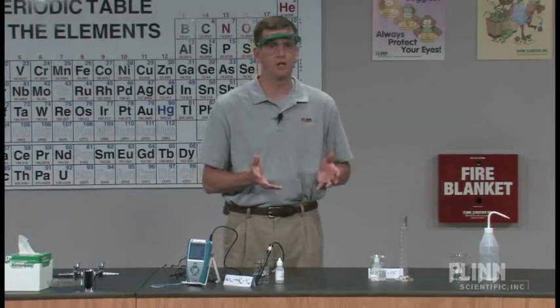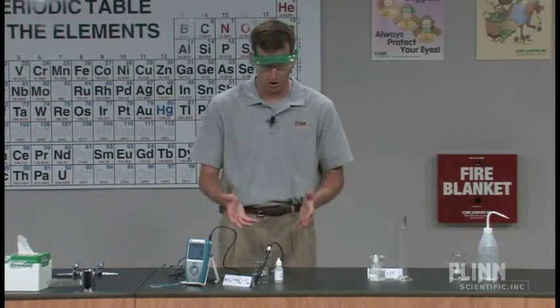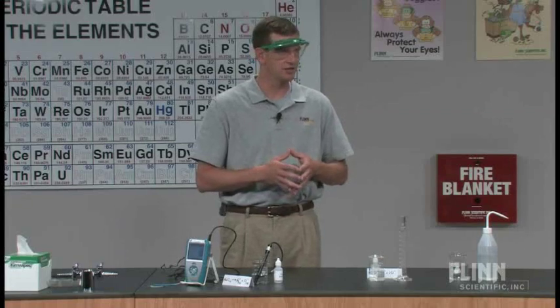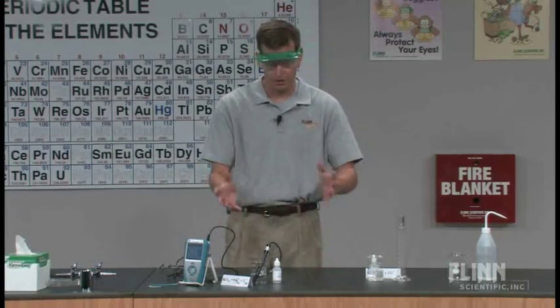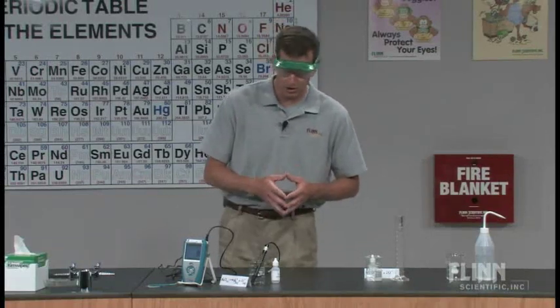But I think this takes it one step further, put some numbers along with that conductivity, and gives kids that really good sense of how many ions are flying around in solution at that particular point in time.